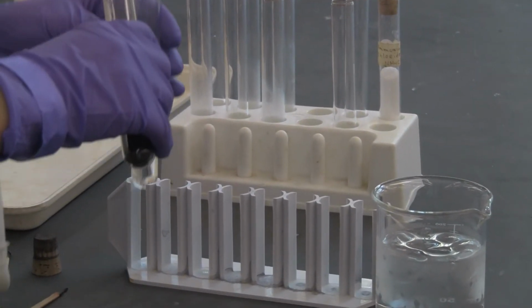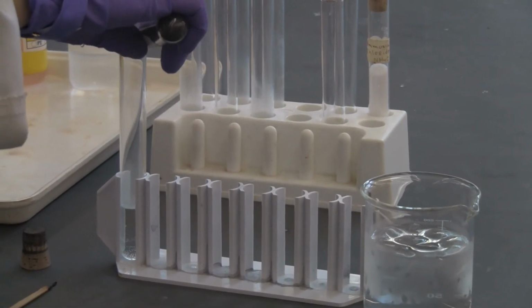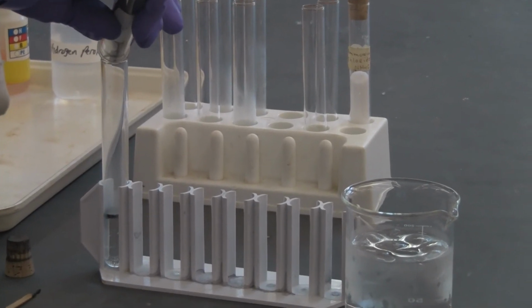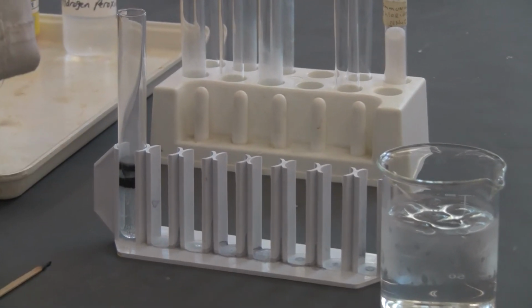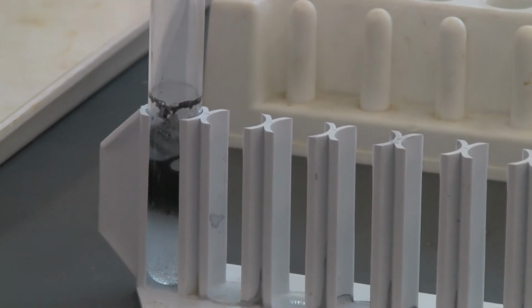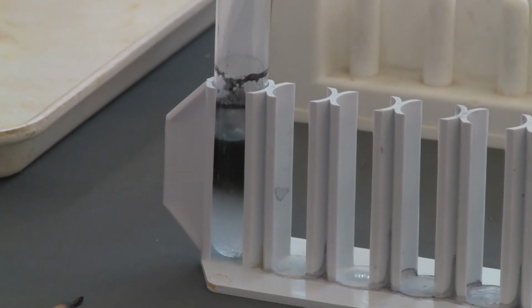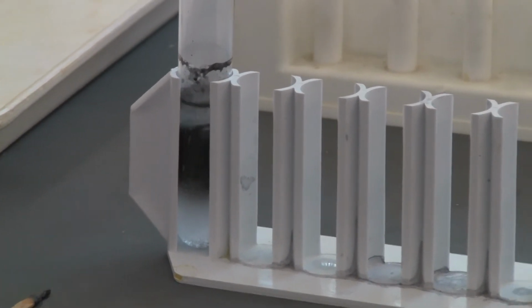I'm going to shake some manganese oxide in there. We just need some catalyst. Ooh, something is happening. I'm going to put a stopper on and accumulate the gas. Later we're going to check. You see that with the catalyst, the reaction is different. The rate is changed.